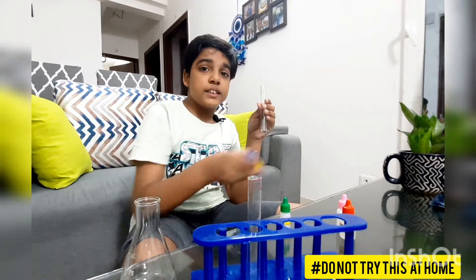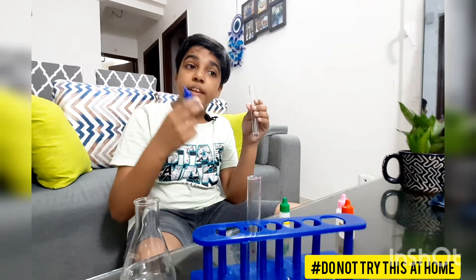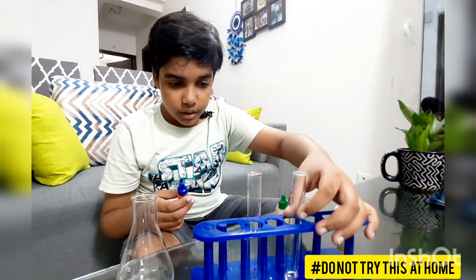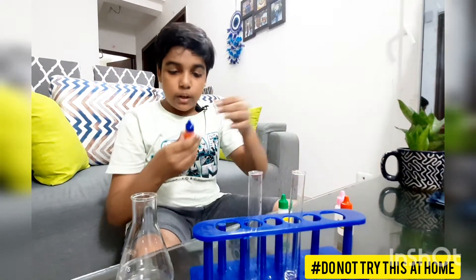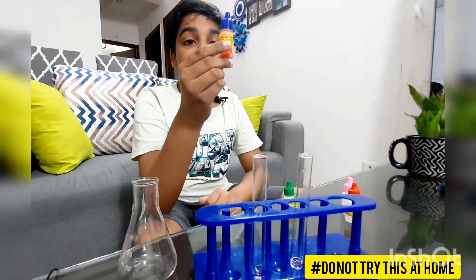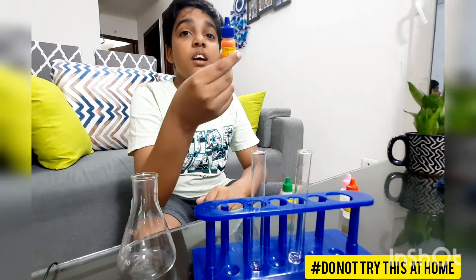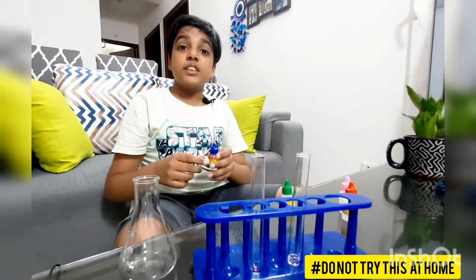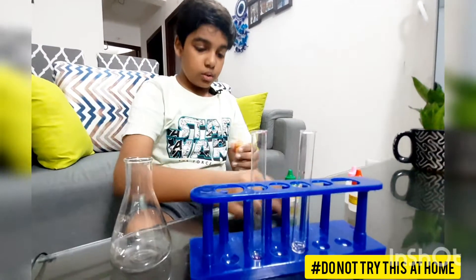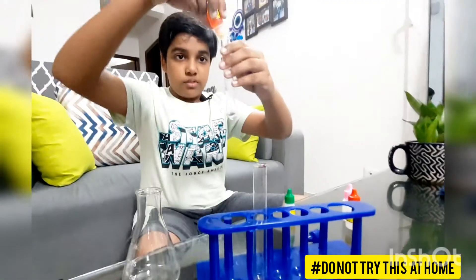For this I can check it with the help of methyl orange indicator. Methyl orange is a bright orange colored dye — a synthetic indicator. So now let's see which chemical is present in a greater amount.